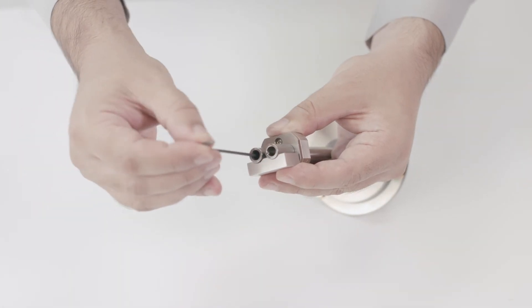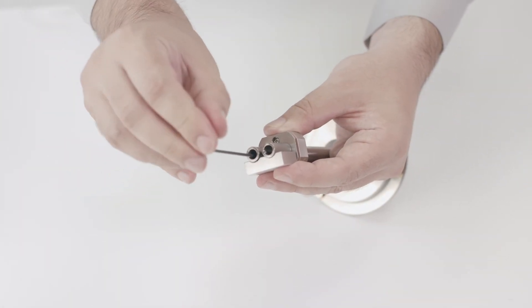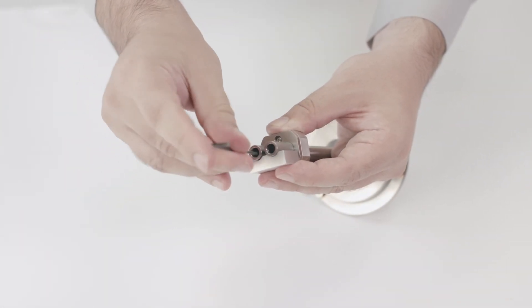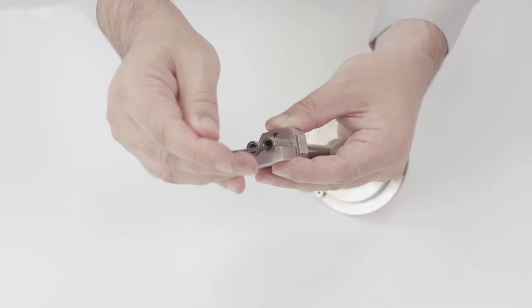The drums can be removed for cleaning using the drum mounting fixture and the hex key. Roughened or knurled drums are also available.